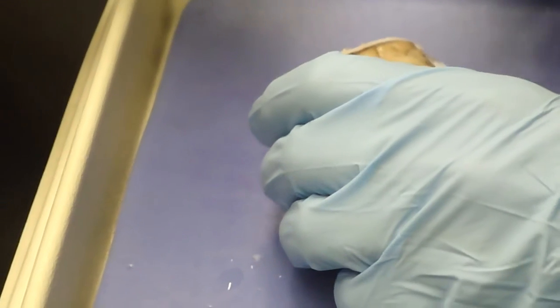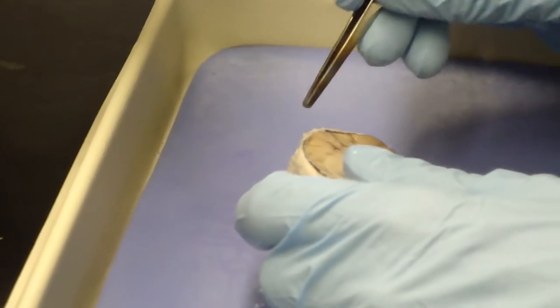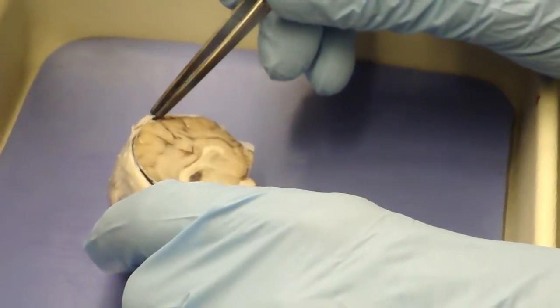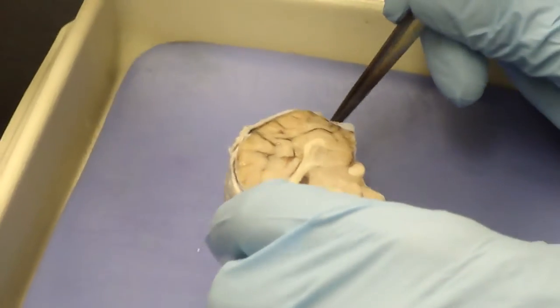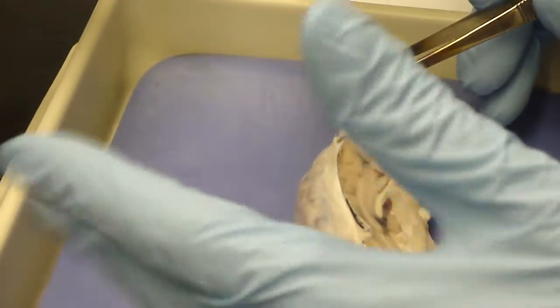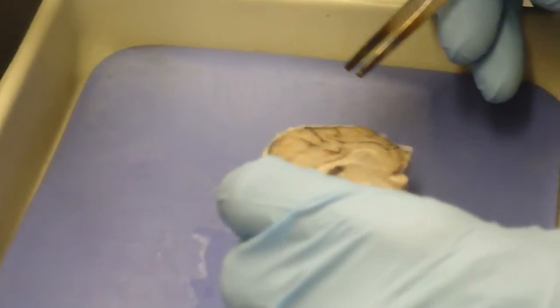The space in mammals between the dura and the pia has another membrane that has little web-like fibers that extend from one to the other. That's called the subarachnoid space. Arachnoid because arachnids are spiders and they make webs. So that space is the subarachnoid space between the two membranes, and there is a kind of layer sandwiched in there, the arachnoid. The subarachnoid space has cerebrospinal fluid circulating in it, so it's part of the whole system of fluid in the central nervous system.